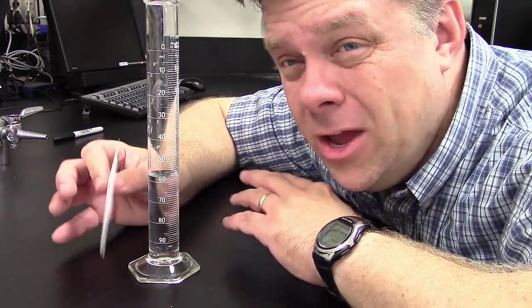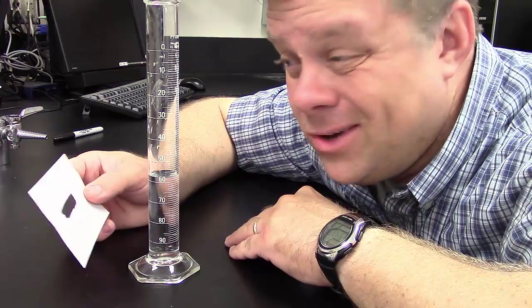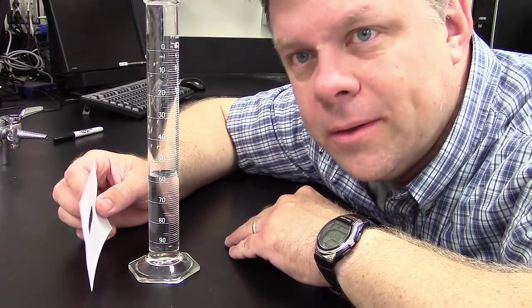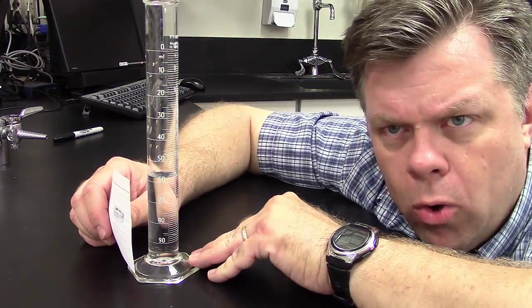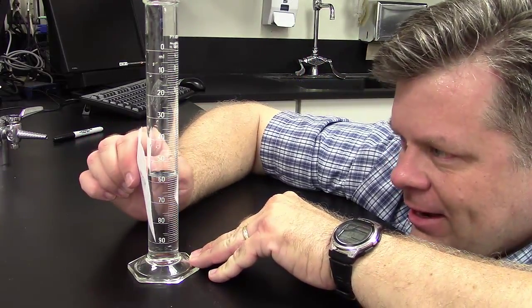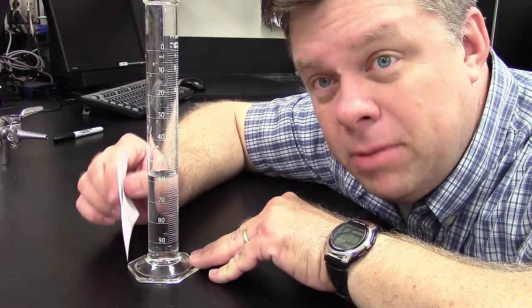Now, I expect to see, when you're measuring in lab, you down at eye level. If I don't, I might be prone to come up behind you and go, I don't think that's the right measure. You need to measure that one again. So again, be sure you're helping your teammates out. When you're measuring with a graduated cylinder, you've got to get low. How low do you go? To eye level with that liquid. Make sure you're measuring correctly and be safe, but have fun in lab too.